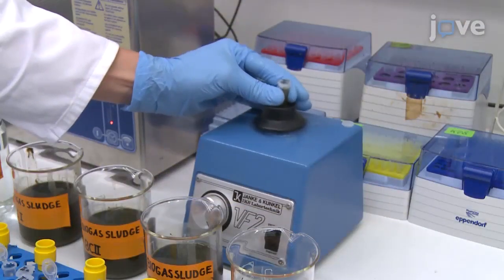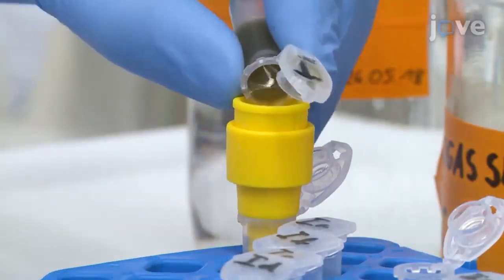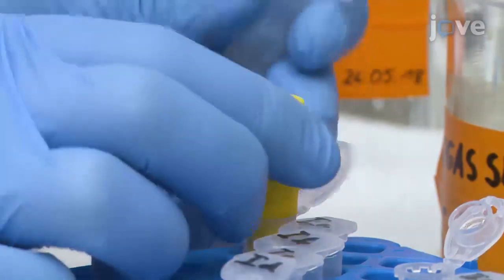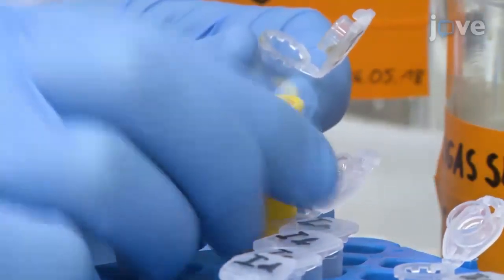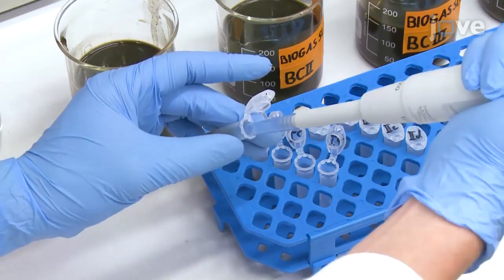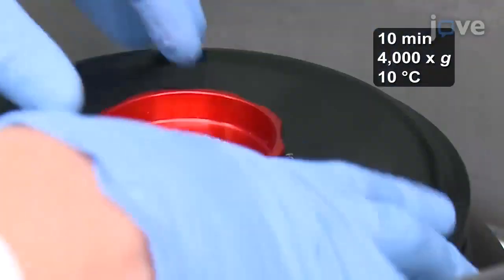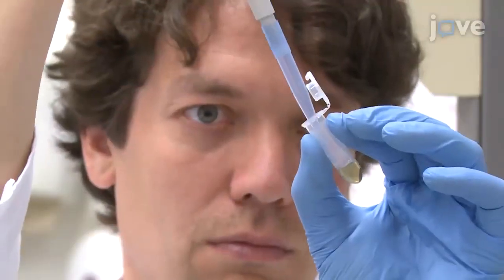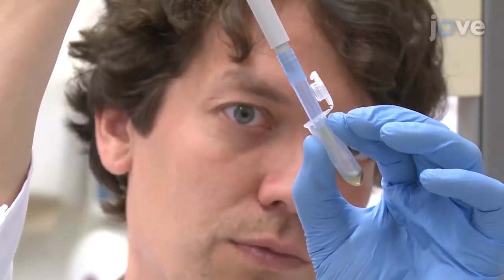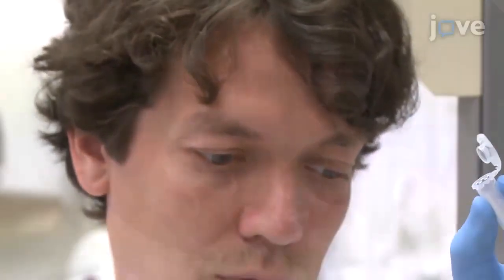After the sonication, mix the sample thoroughly and filter the cells through a 50 micrometer pore mesh strainer into a 2 ml plastic tube. Divide the filtrate into 4 400 microliter aliquots and centrifuge the aliquots 2 times, discarding the supernatant completely both times to mechanically dewater the microbe sample as thoroughly as possible.